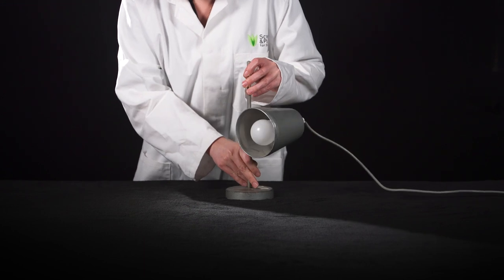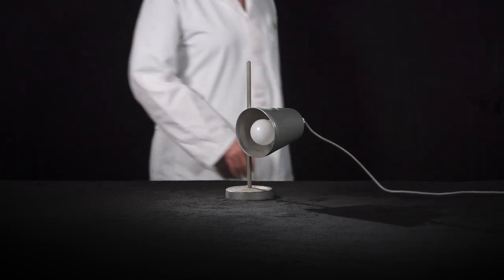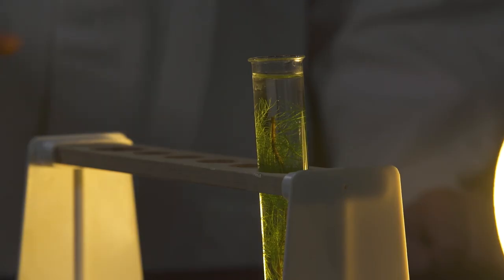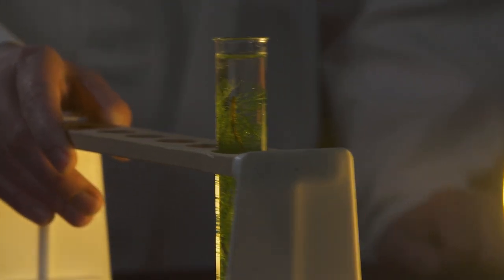Bright light bulbs will ensure that students will be able to investigate the effect of light intensity effectively by moving their setup away from the light source.